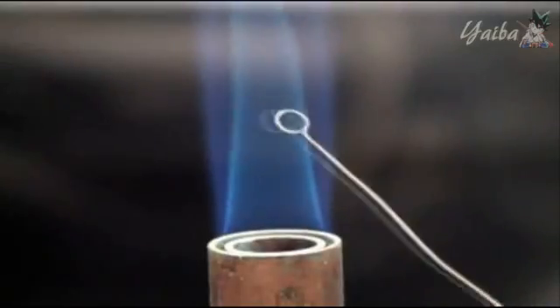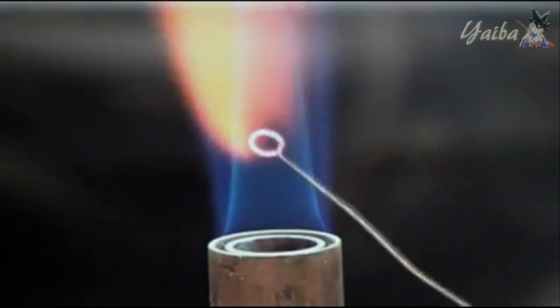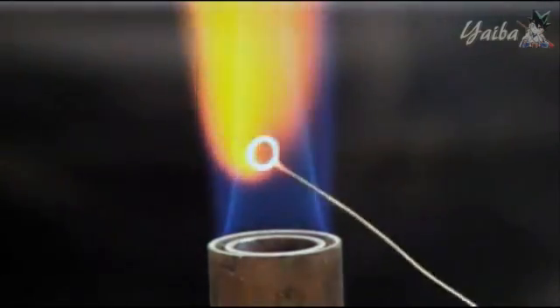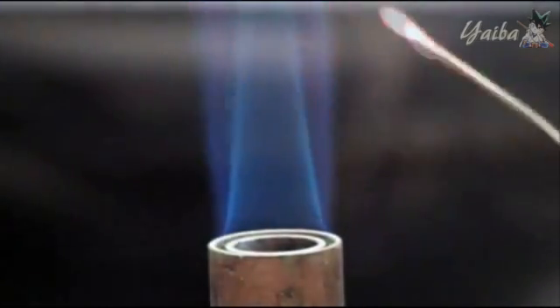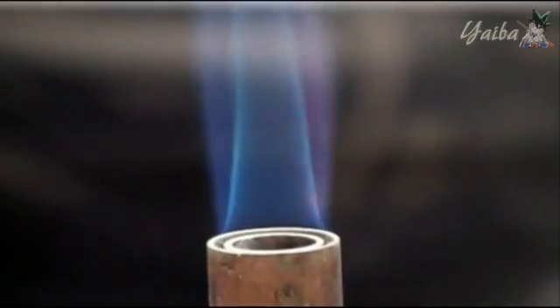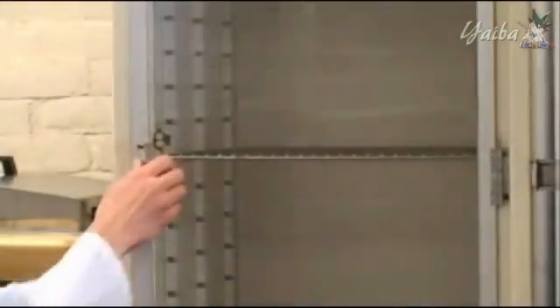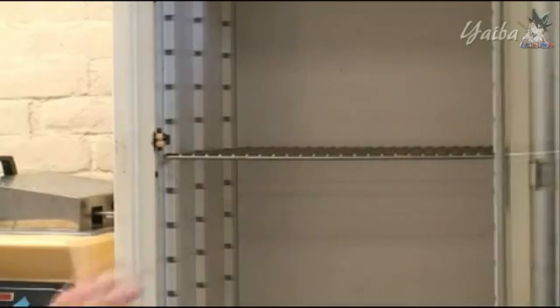The plate is now streaked and must next be incubated for the cells to divide effectively. Different cells grow most efficiently at different temperatures. In this case, we are culturing bacillus, which grows best at 30 degrees Celsius. Incubators in the lab are clearly marked with their maintained temperatures and are located in the back. In the case of bacillus, we will wait up to 48 hours before we check the plate for growth.